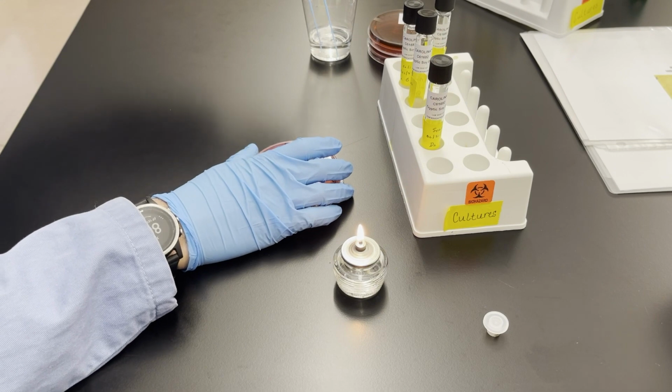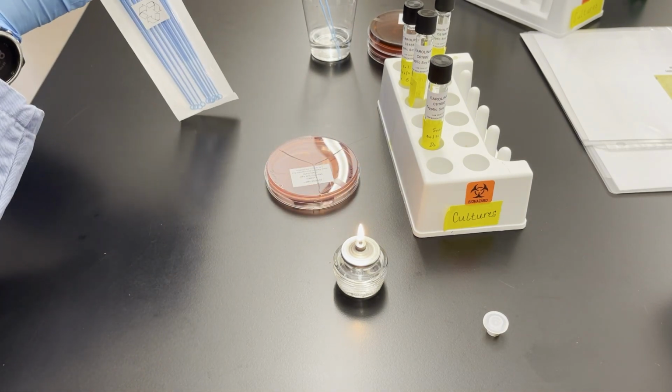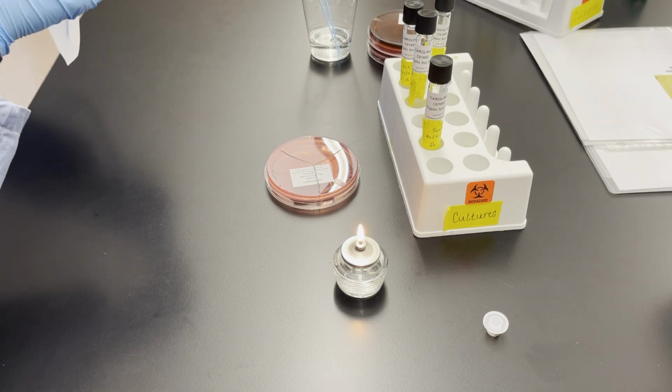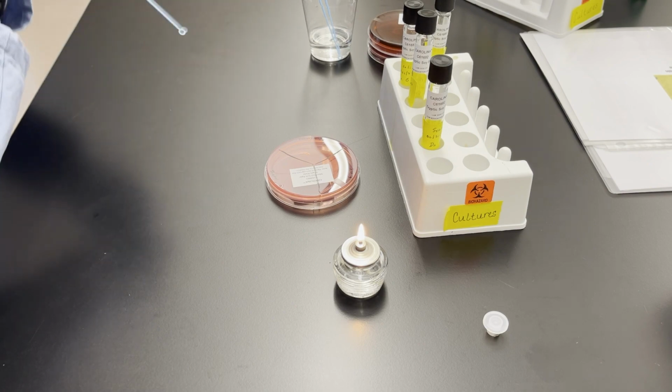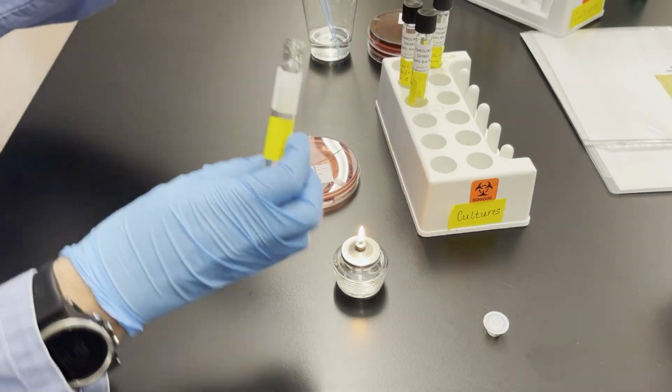And then I'm going to streak this into the micrococcus section. So don't touch it to the E. coli. These are separate sections. And then discard that loop. And I have one more bacteria to put on, and that's going to be the staph culture. So this is a fresh sterile loop. Same procedure, loosen the lid.